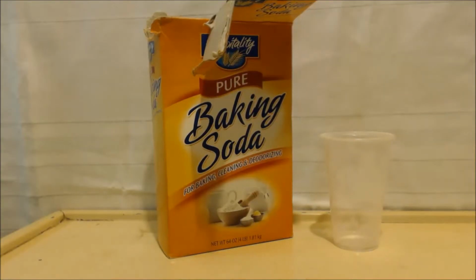Wow, I am actually impressed. I cannot believe this. I put it all in. I still got a pH of 8, and still reacting very, very slowly. So I threw in another gram, and it reacted with that. But after that, that was it. There might have been some in solution that didn't react. I might have added a little bit more alcohol than I thought, a couple milliliters of water. I mean, ethanol. But this is pretty much a 100% conversion, man.